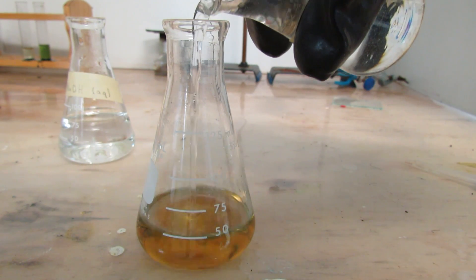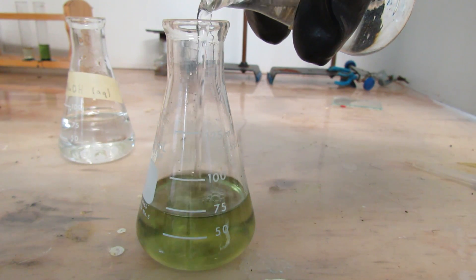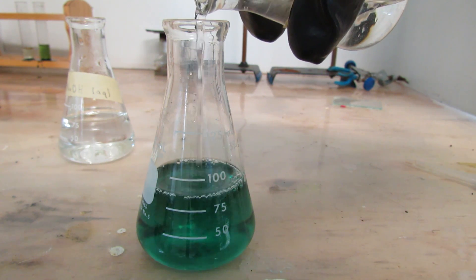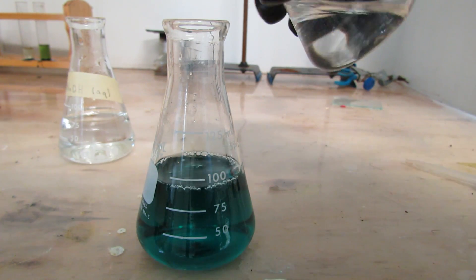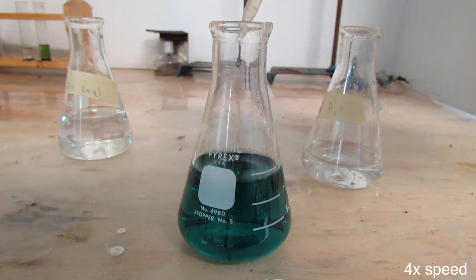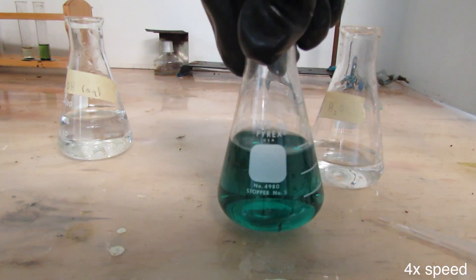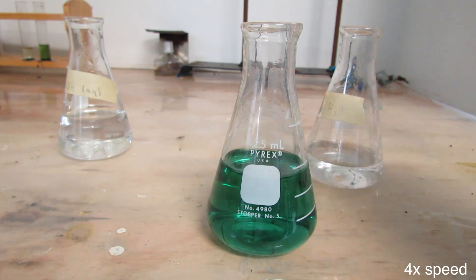Now, I decided to add about 50 more milliliters of water and after I did that you can see that it threw the balance of this reaction off and turned it back blue again. So, I just had to add a few more drops of sodium hydroxide solution that reversed it.